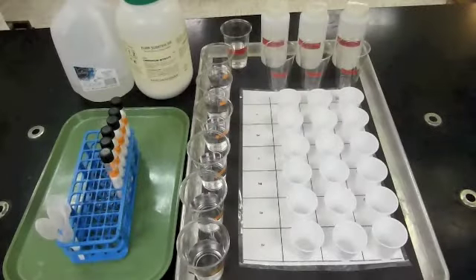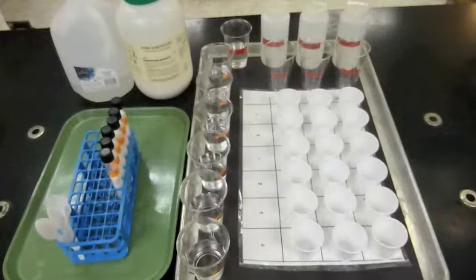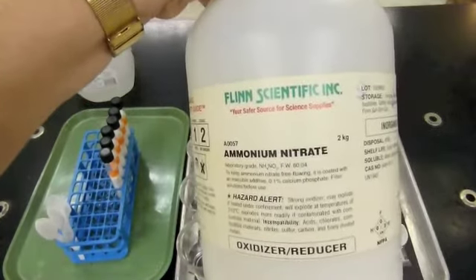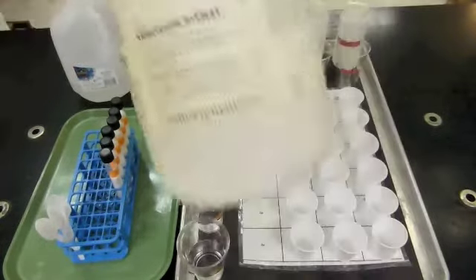Just a quick word about making solutions and observing solubility. On the back of the first page, I want to just go through the solubilities of the solutions that you're using that contain the negative ions, including one that you're not going to be testing, but one that's still an important part of the investigation. This one right here, ammonium nitrate. Let me show you how to make a mixture using this one and how to make observations of solubility.